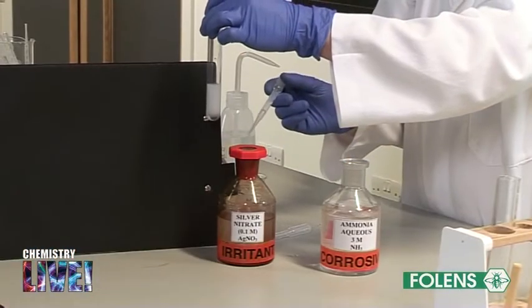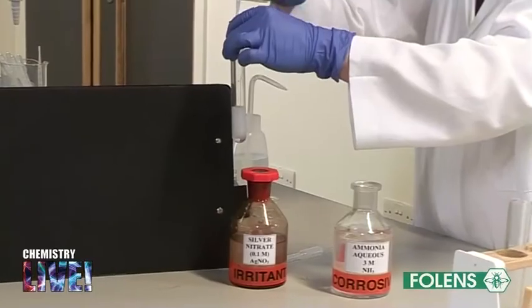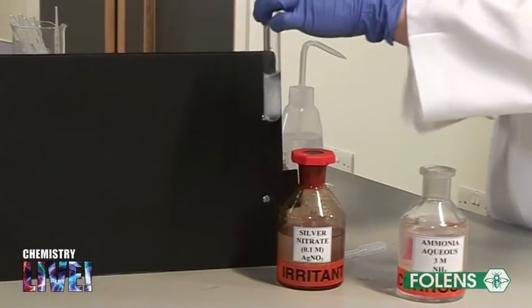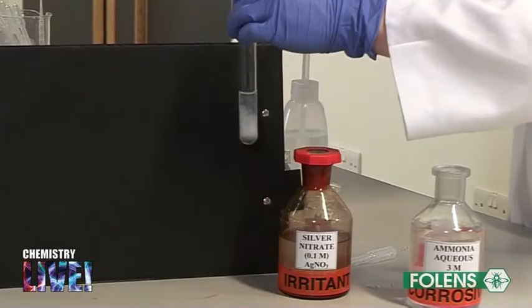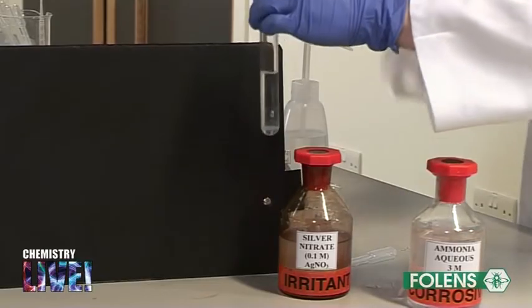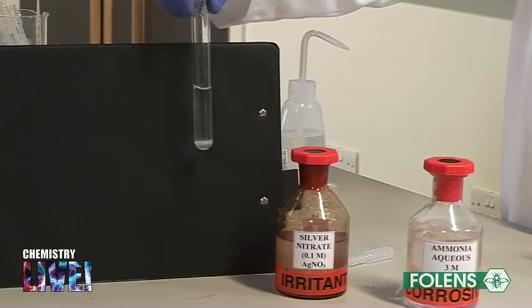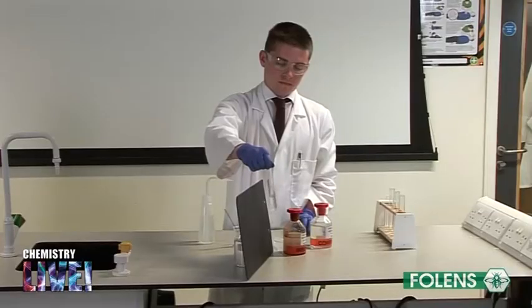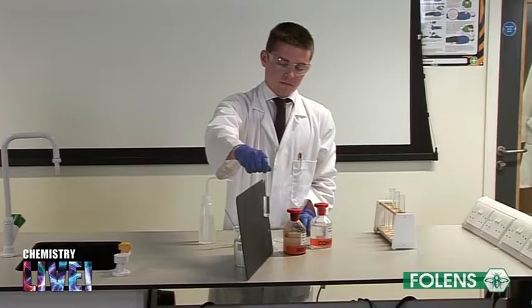To confirm that the white precipitate is silver chloride, add about a quarter of a test tube of dilute ammonia solution and shake gently. Silver chloride is soluble in dilute ammonia solution, thus the cloudiness disappears. We conclude from these results that the chloride ions are present in solution.